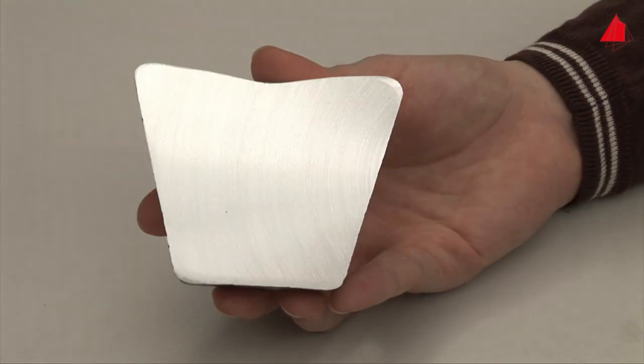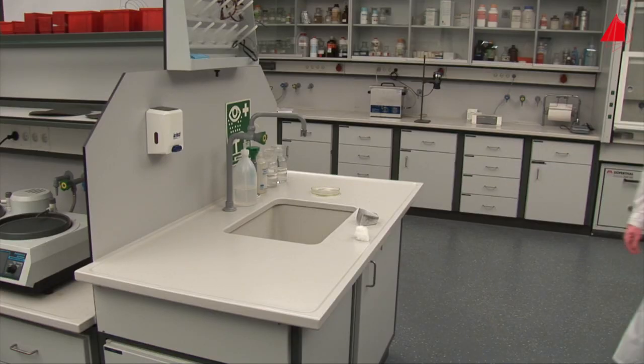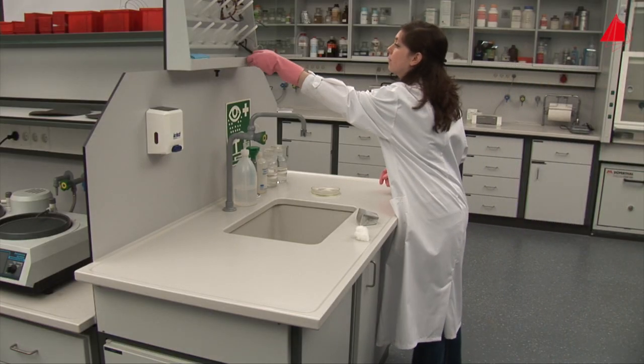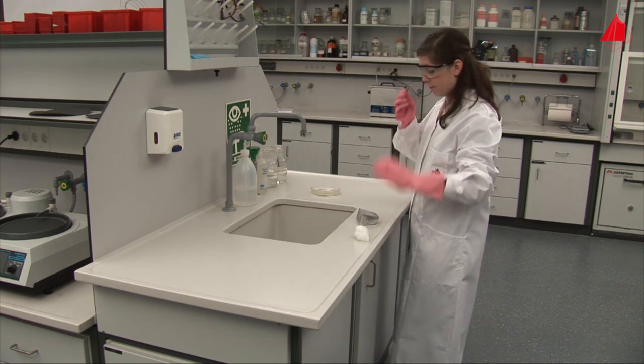Now, a flat, medium ground surface has been created. But apart from the grinding marks, nothing special can be seen. Our sample reveals its structure only by the final etching process.